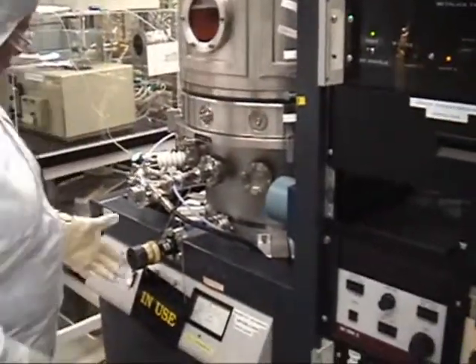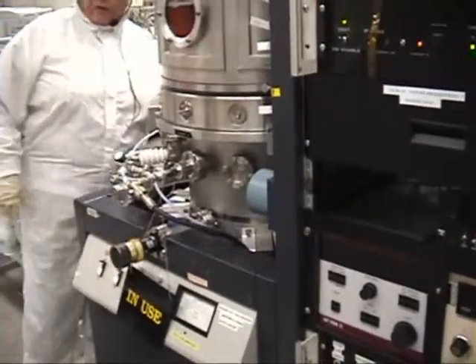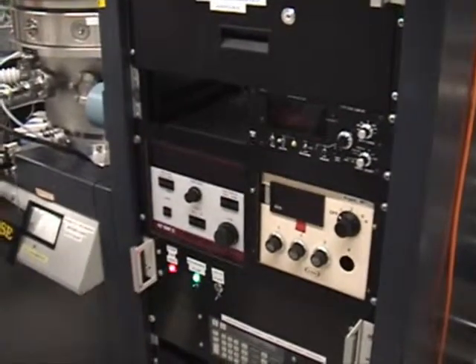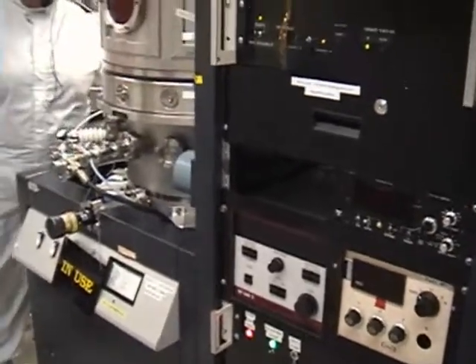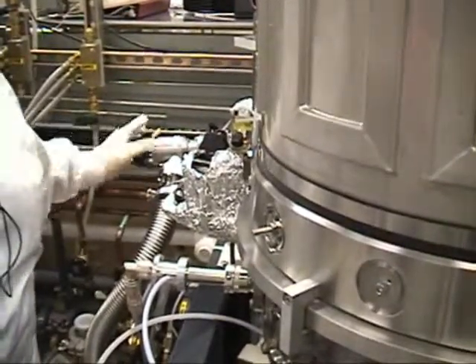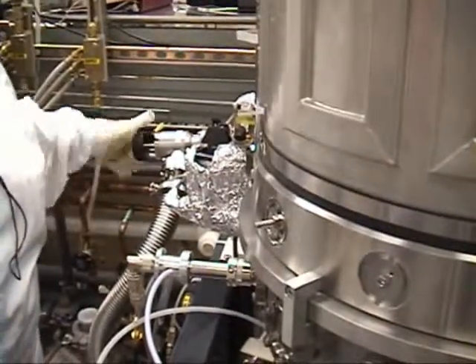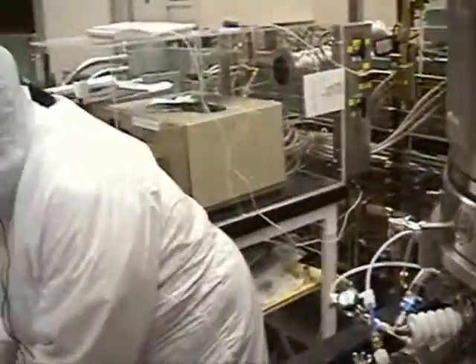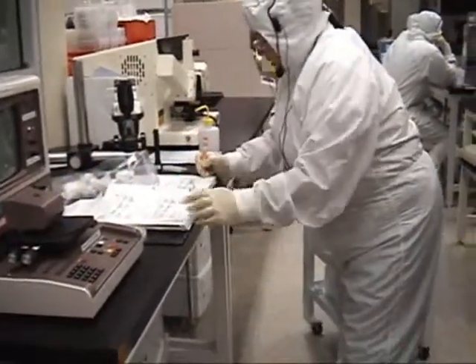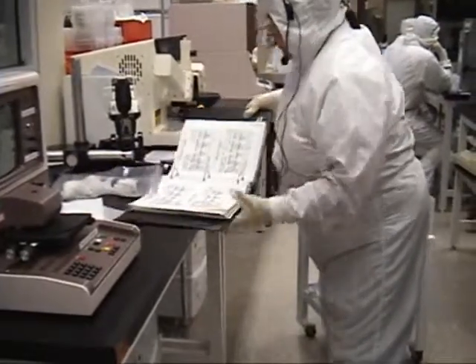To use the roughing pump, you want to still make sure gate valve and roughing valve are both closed. We're going to raise the roughing pump — light comes on. Open your roughing valve — loud at first. Once it reaches 150 millitorr, we can close it. Make sure you switch the roughing pump toggle back down. Make sure your log book is filled out. Put your metal box in your roll around cart. If you had a problem, don't forget to note it in the log book.